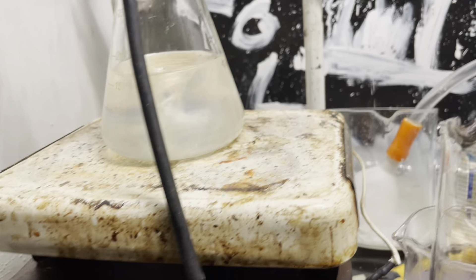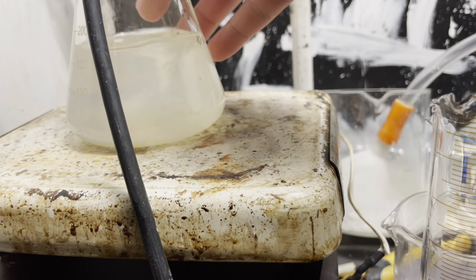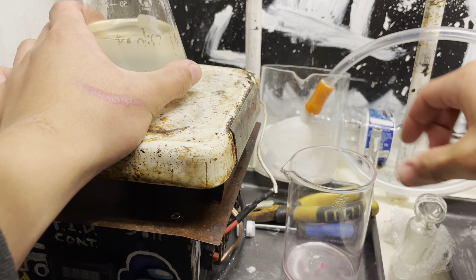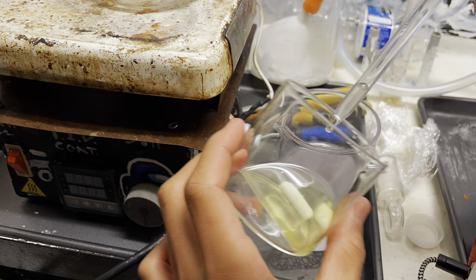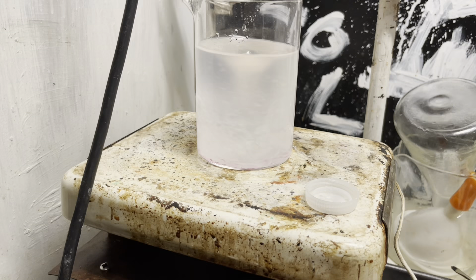Even with very strong stirring, the sulfuric acid really does not want to mix. The density really is different. After 30 minutes of strong stirring, the sulfuric acid went yellow, and now we're going to separate the toluene off by just decanting it. You could use a funnel, but you don't have to. And then my OCD kicked in, and of course, I had to use a pipette to separate it.